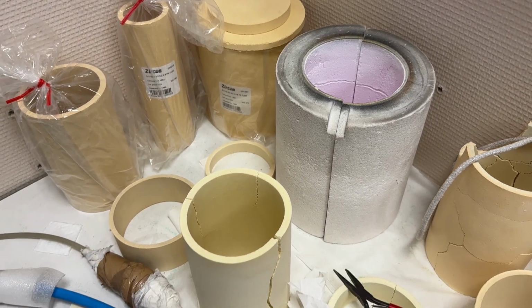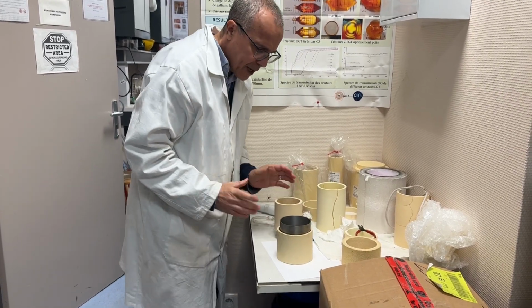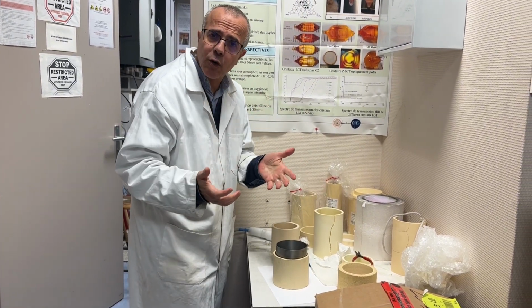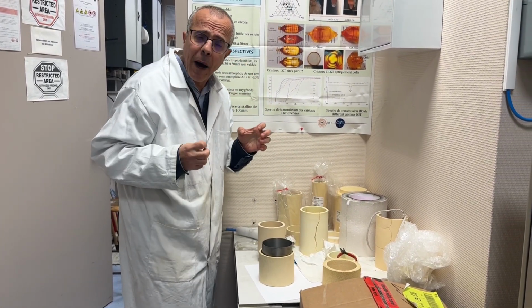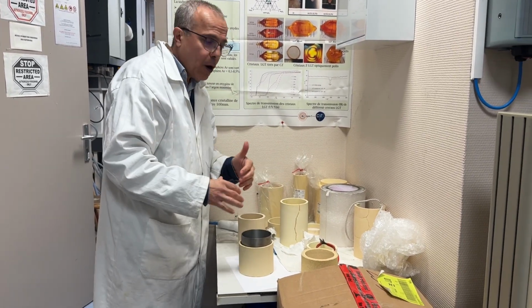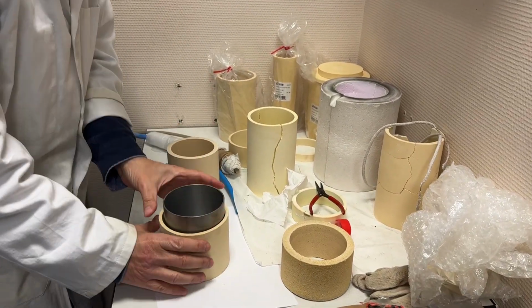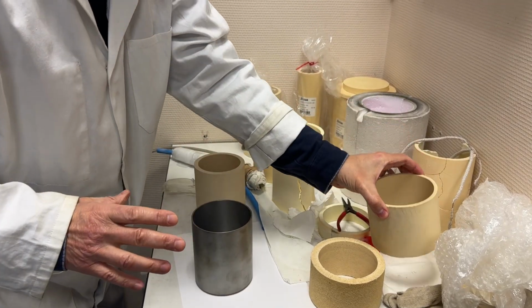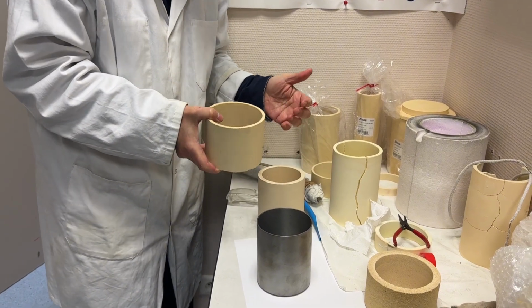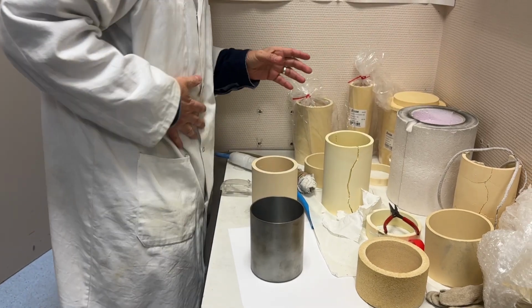But before starting we have to protect the crucible with specific thermal insulation, to not lose the heat and to use all the power necessary to melt the material. And here you see, depending on the material, the temperature, and the thermal gradient, for each crucible we have a specific thermal insulation. That is zirconia. You see, we have different sizes and different diameters, so depending on the size, we need a specific thermal insulation.